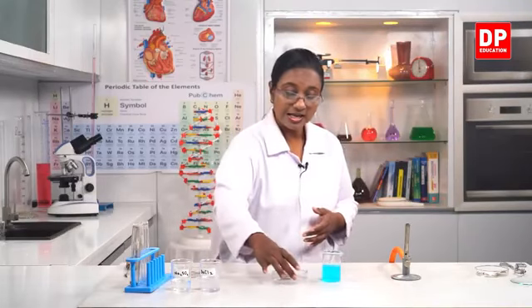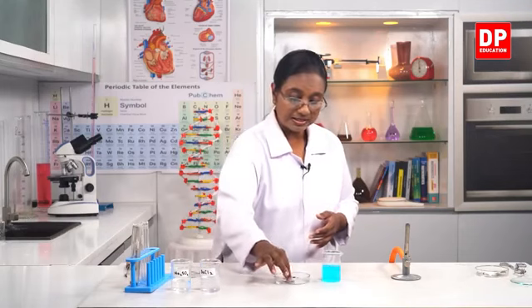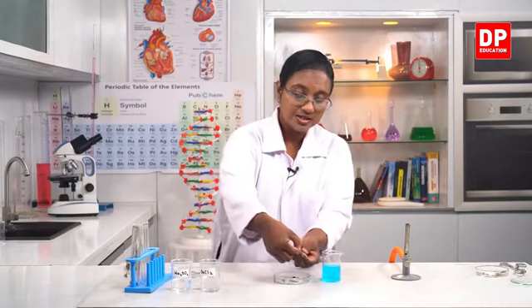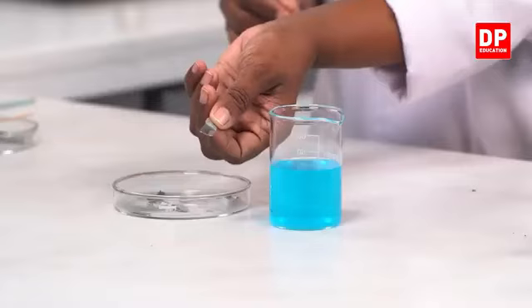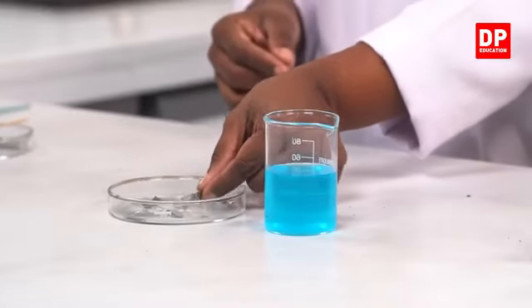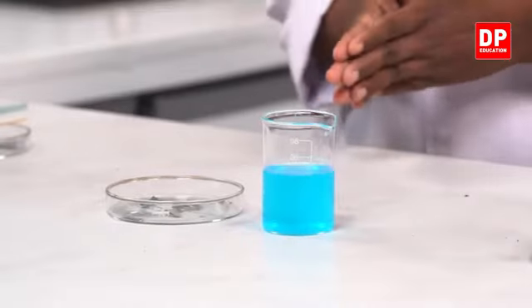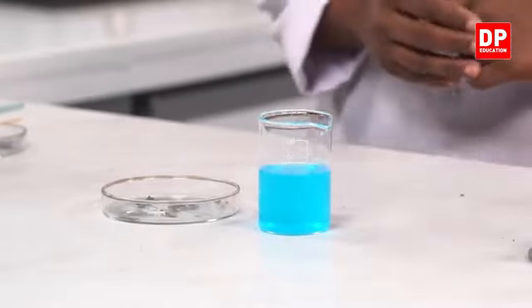Then I have zinc here. You can see the zinc. Again, zinc is a metal. You can see here, students, the shiny zinc metal. I'll be using a very small piece of zinc. When we put it into copper sulfate, you will have to observe what happens there. So here, of course, we are taking two initial substances or two reactants, copper sulfate and zinc.